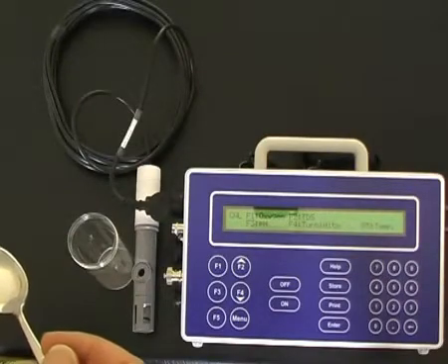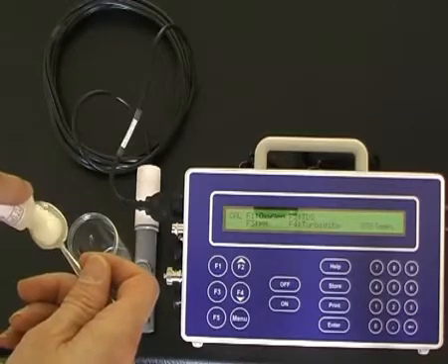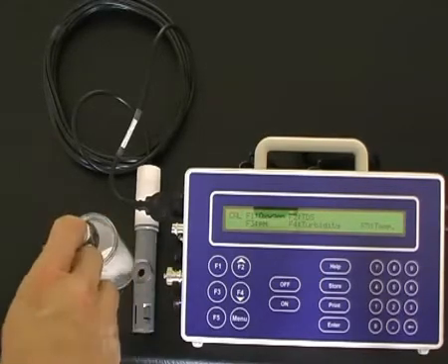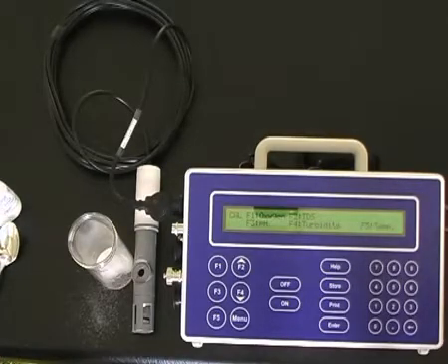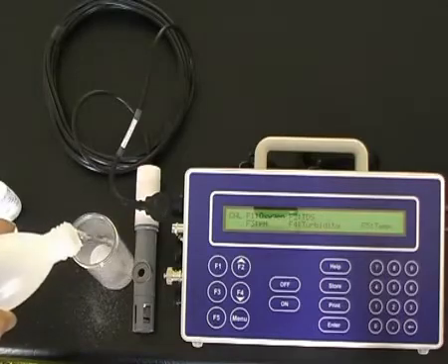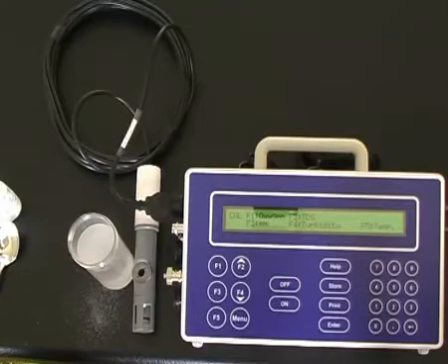To prepare the sodium sulfite zero solution, pour a teaspoon of the sodium sulfite powder into a jar and add 100 ml of water. Stir the solution until the sodium sulfite powder is completely dissolved.